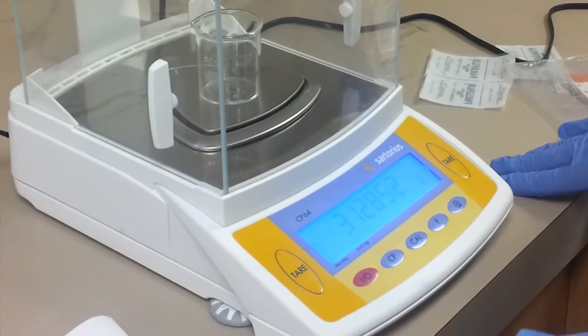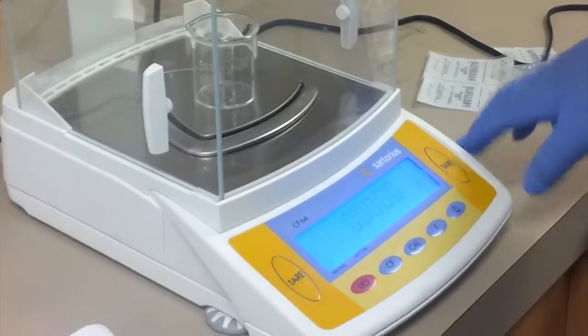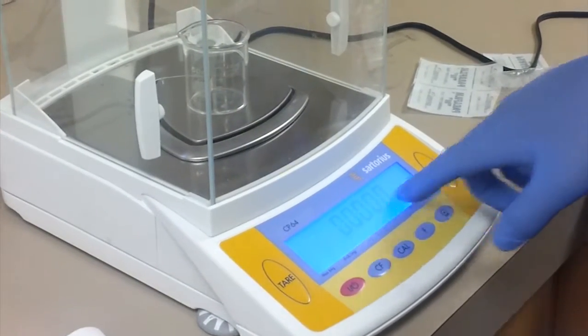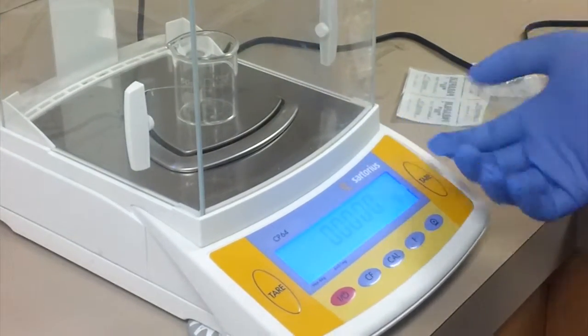If for whatever reason you wanted to add something, we just hit the tare button here. As you can see, it is reset to zero grams.